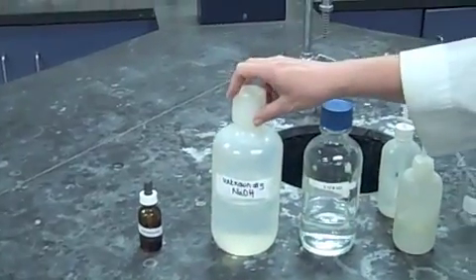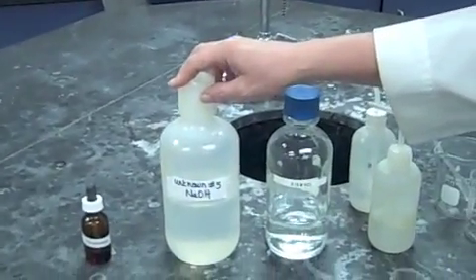First thing you'll need is a colored sheet of paper, hopefully, or a white note card or white sheet of paper. You'll need phenolphthalein and the unknown base that you're going to titrate.